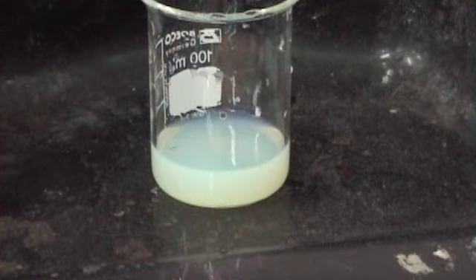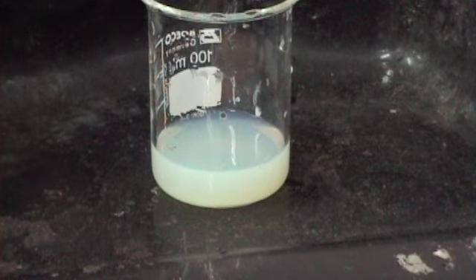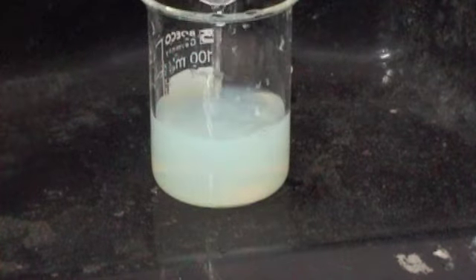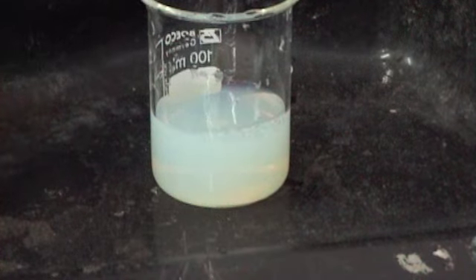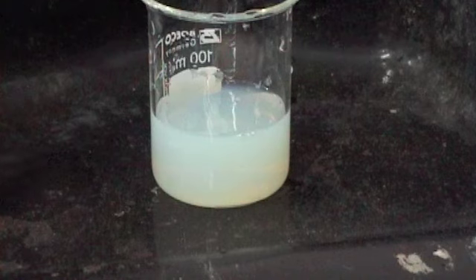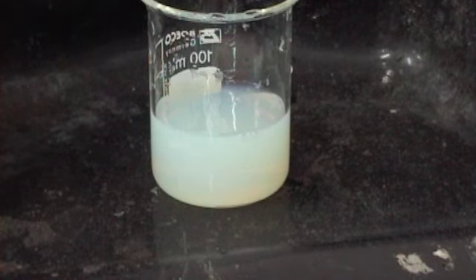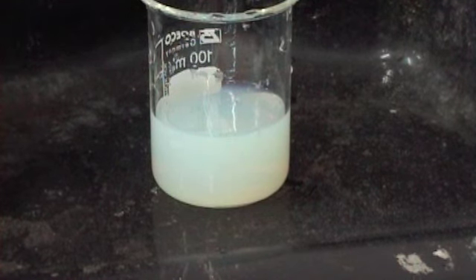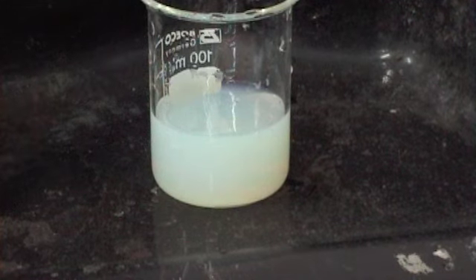Now, when we add ammonia to this, to confirm it's iodide, the precipitate should not dissolve. Because if it did dissolve, it would be chloride, yeah. So I'll put some ammonia in. Okay. You could say, well, you could put more in. Blah, blah, blah. I can, but it's not going to change. Okay. So that precipitate is fixed. All right, silver iodide. All right, so we've shown that there was iodide and sodium, so it was sodium iodide. Questions? Okay, if you've got those sequences with them numbered, you're okay. You've got it sorted. All right.